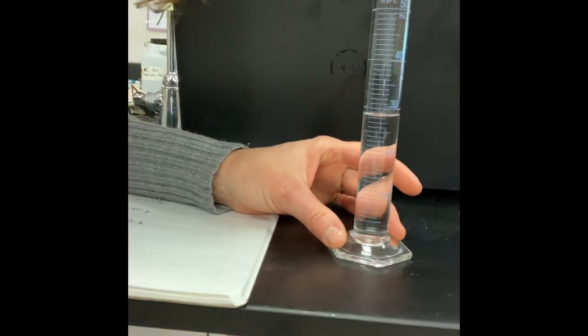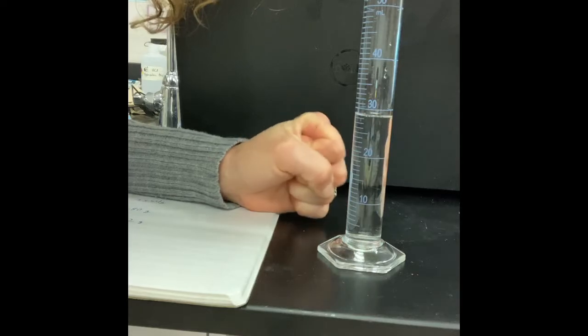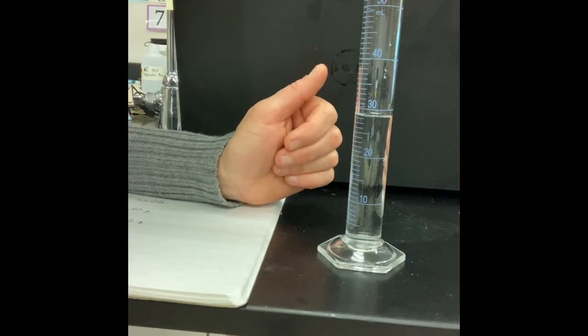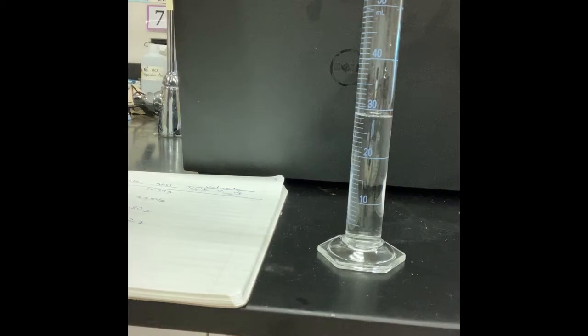Sample will be submerged, but not so much that it's going to overflow. And for me, I'm really wanting to keep it in the camera view. So I don't know how much is in there. I just kind of dumped some in. What I do need to know is exactly how much water is in there, right? I don't care what amount I started with. I just have to make sure I record whatever that amount is perfectly, okay?